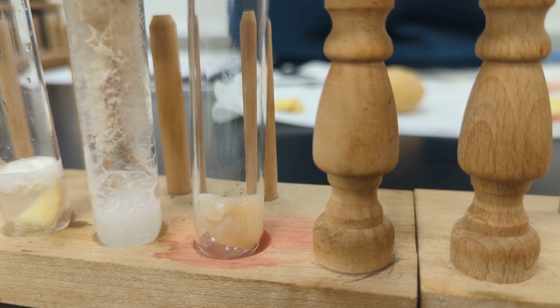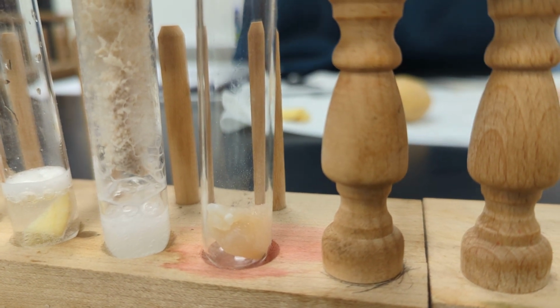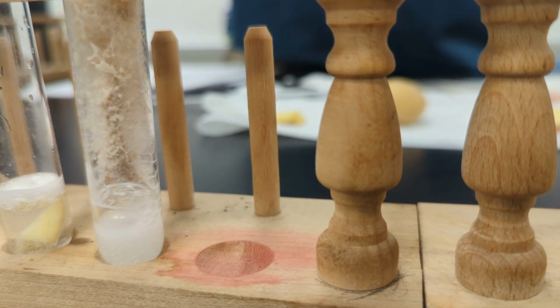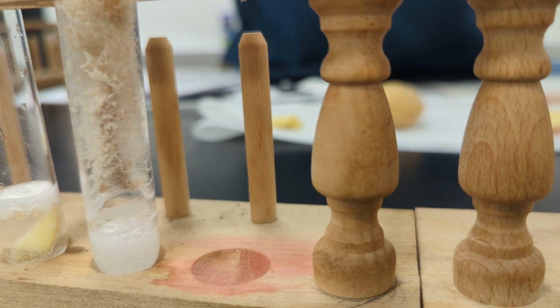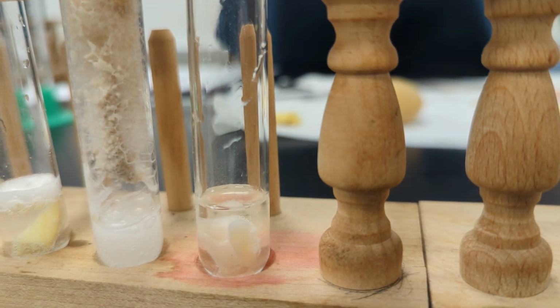Chicken muscle. What's the difference between chicken liver and chicken muscle? The liver is the organ within the chicken. This is the muscle. Don't they always taste the same? Fried chicken? I never had liver.